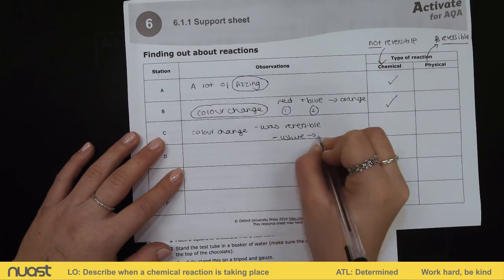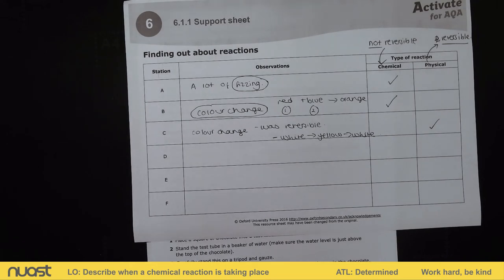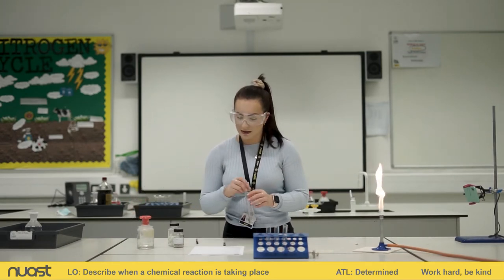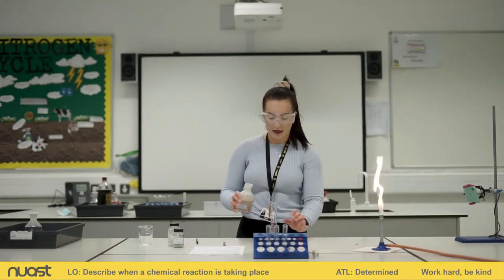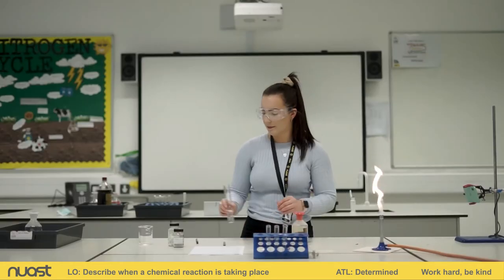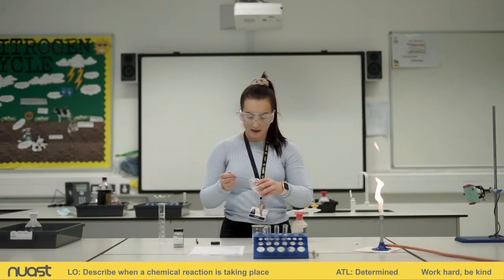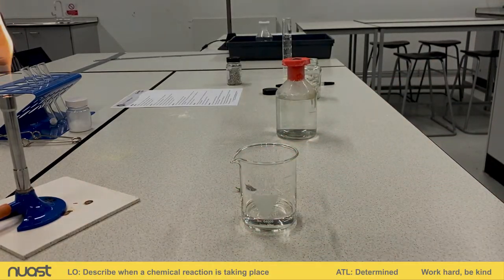We're going on to experiment D now. Experiment D asks us to measure out 25 centimetre cubed of hydrochloric acid in our measuring cylinder, then put that into a small beaker and add a marble chip. I've got my hydrochloric acid and I'm going to measure out 25 centimetre cubed and add that into my beaker. Then I'm going to add a marble chip, and if we need to add some smaller ones so you can see more clearly, we can do that too.